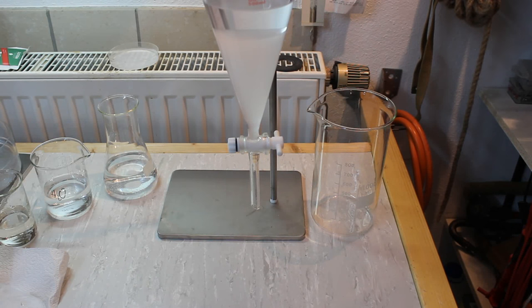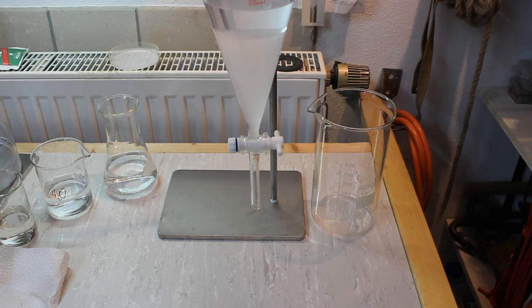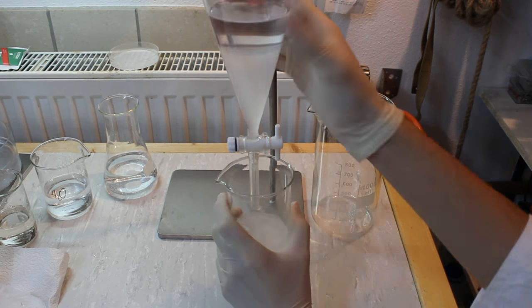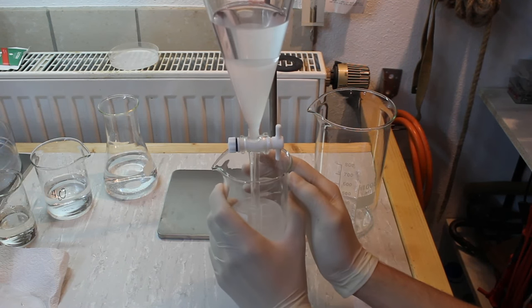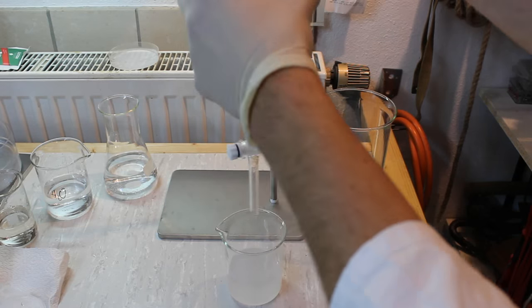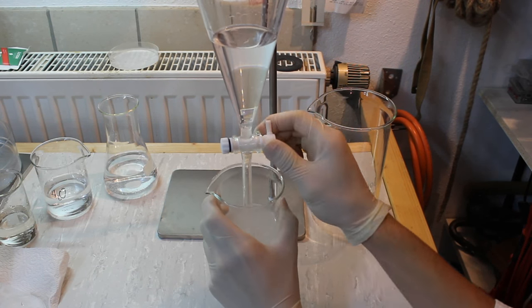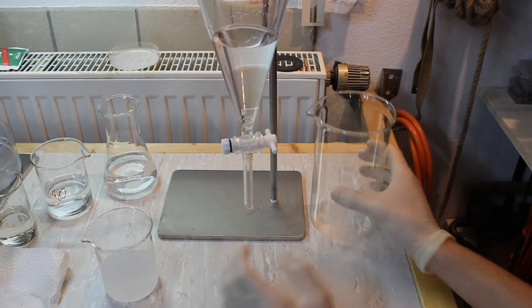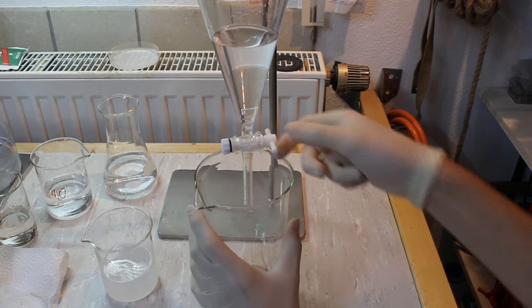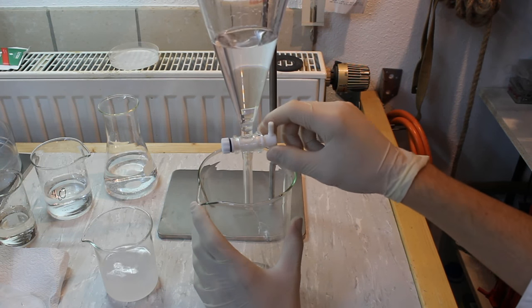First I'll drain the lower layer containing our product, then I drain the aqueous layer which will be discarded.